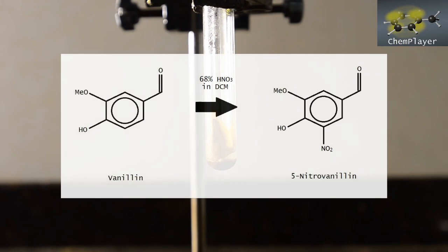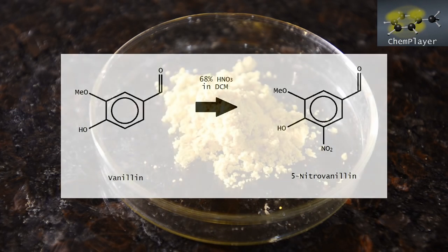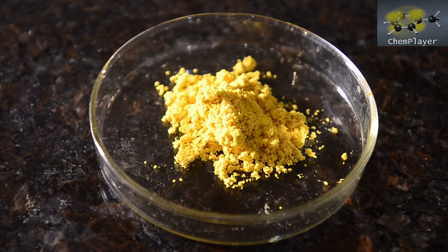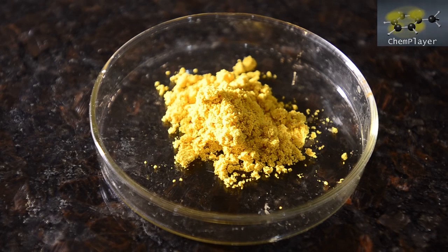So we're going to tentatively assume that what we've got as a recrystallized product is 5-nitrovanillin. We've got about 5 to 6 grams from the various attempts, so enough for some follow-up reactions. We'll keep experimenting to see if there's a solvent that works better for recrystallization. As we said at the start, doing this in aqueous solution gives a dark colored product with a lot of impurities that seems very difficult to purify. So stay tuned — we will be on vacation for 5 weeks starting in about a week's time, but just as advance warning.